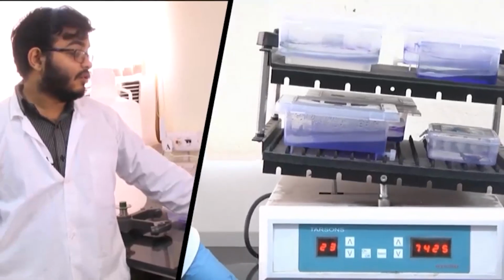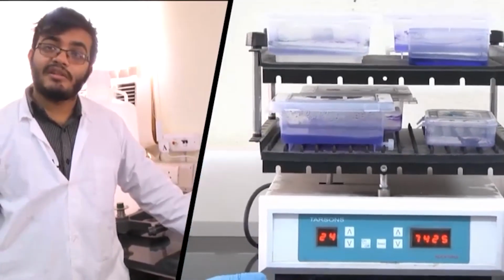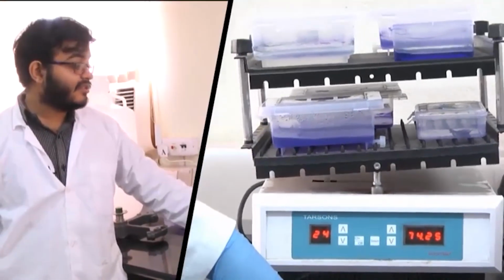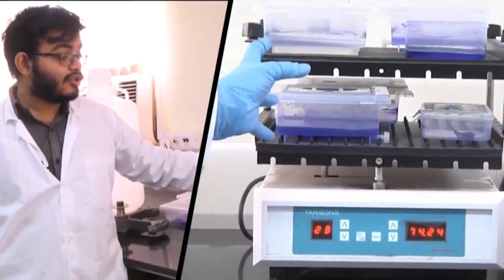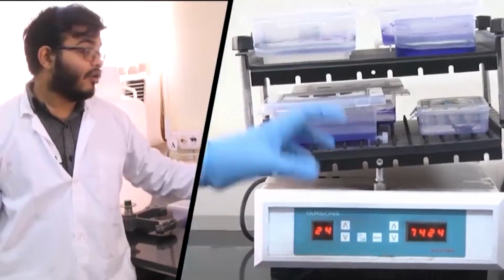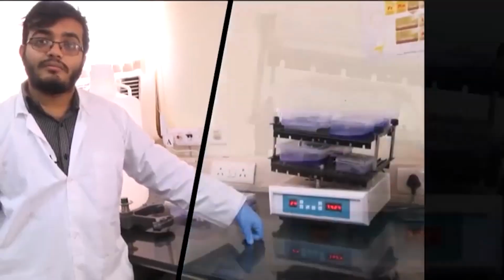proper mixing. So, I understand that you might not be familiar with many of the experimental terms that I used, but that is not the point at the moment. What I want you to realize is we have instruments which ensure proper mixing of different liquids onto solid surfaces or between each other via this gel rocker.